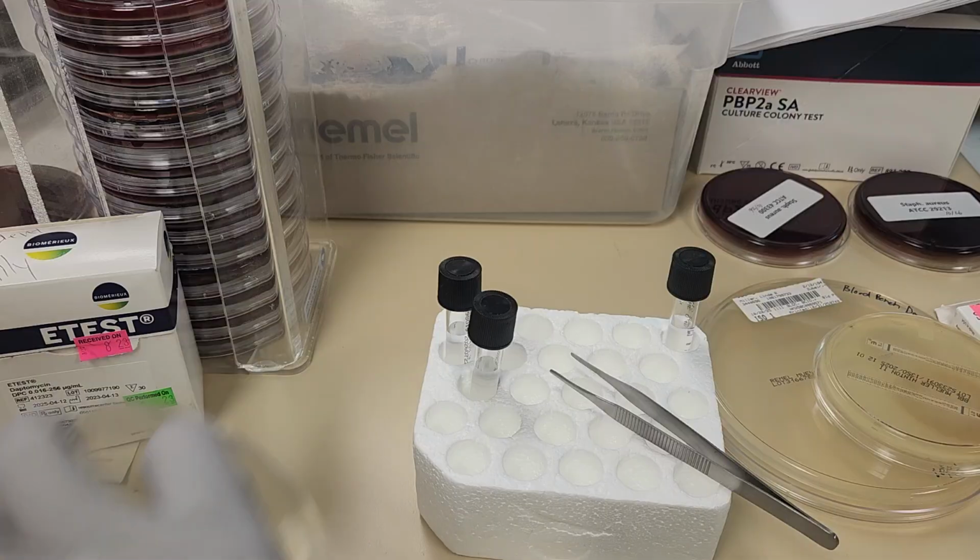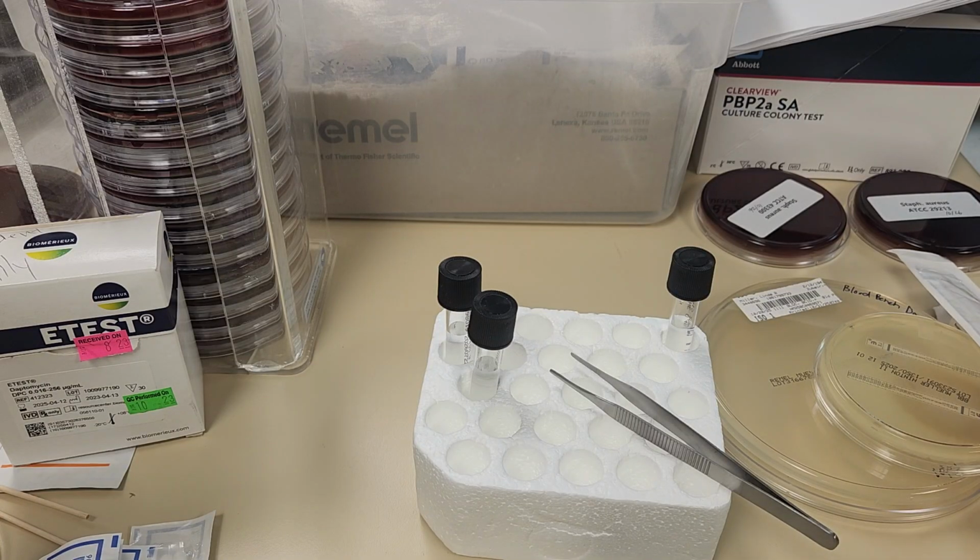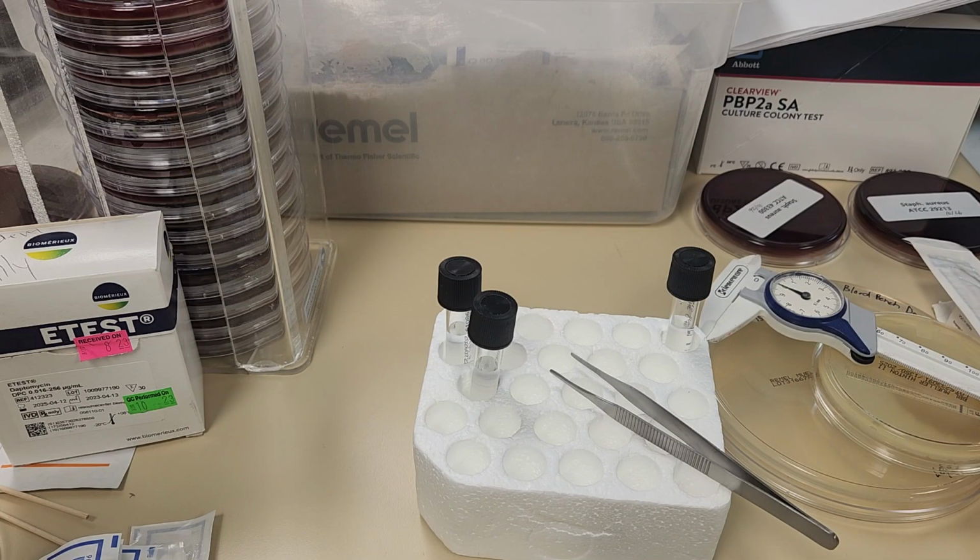Now the next test I'm going to set up is my E-test. E-tests use E-strips, and these are non-porous plastic antibiotic strips. They're different than the Kirby Bauer discs, because remember, those were set at a set concentration on each disc. The E-strip is calibrated with MIC values that cover a wide concentration range. So a predefined antibiotic gradient is immobilized on the surface of the strip.